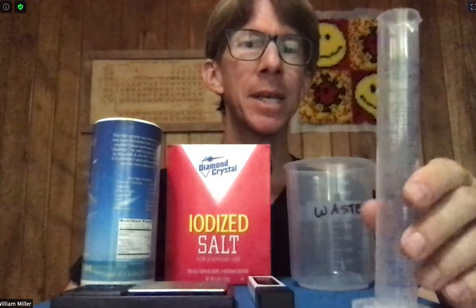I've got my 50.0 milliliter graduated cylinder, and I don't know if you can see it, but it is a little wet. We will talk about the difference between clean and dry versus wet, and when we need to condition this 50 milliliter graduated cylinder and what we will condition it with each time.